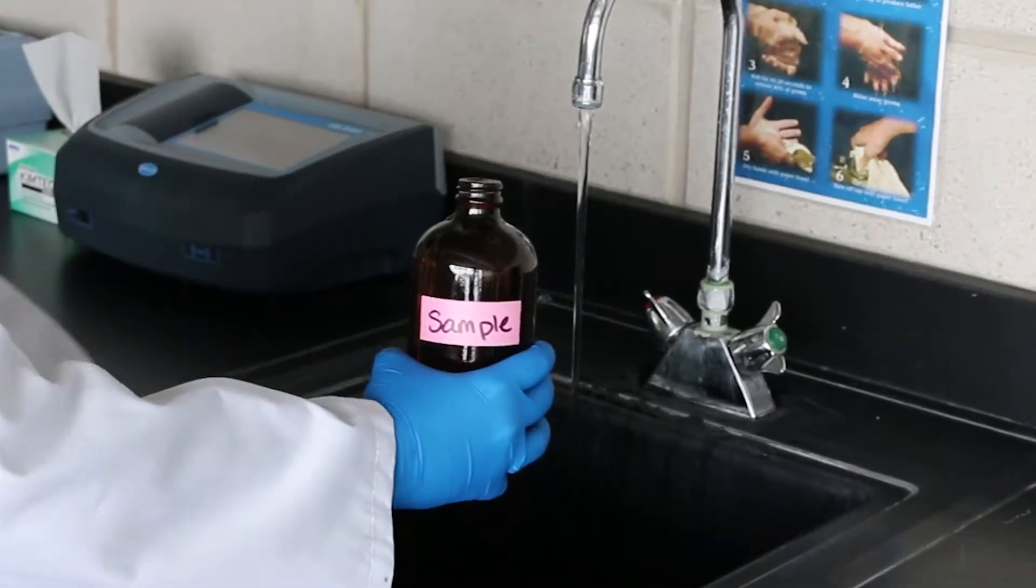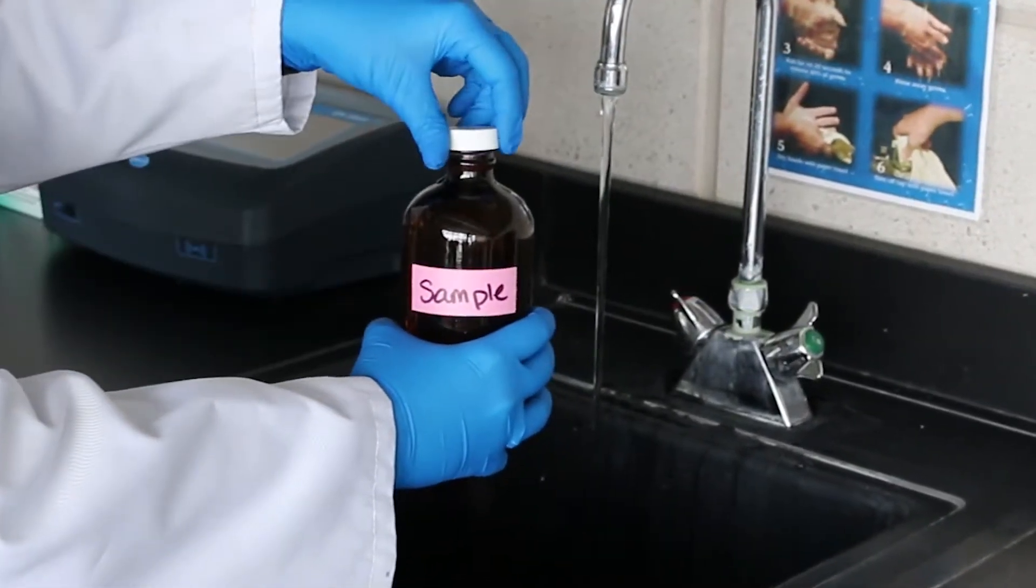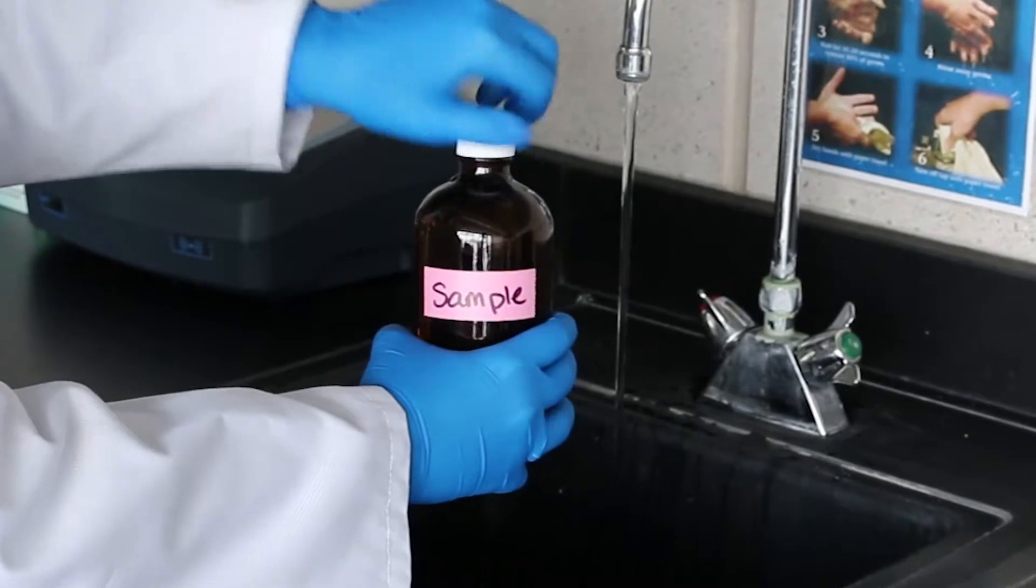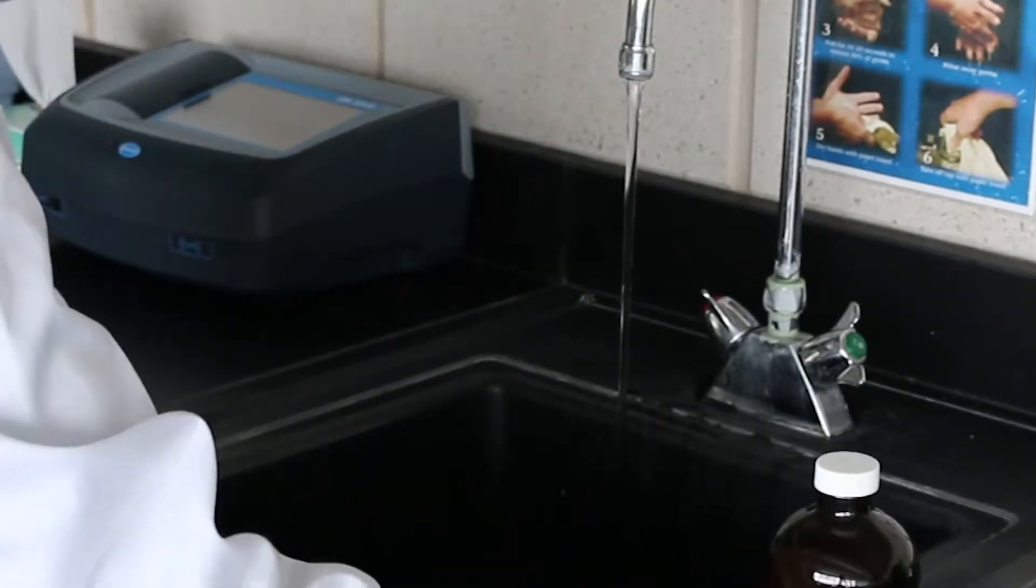The sample must be analyzed immediately after collection and cannot be preserved for later analysis as chlorine is a strong oxidizing agent and is unstable.